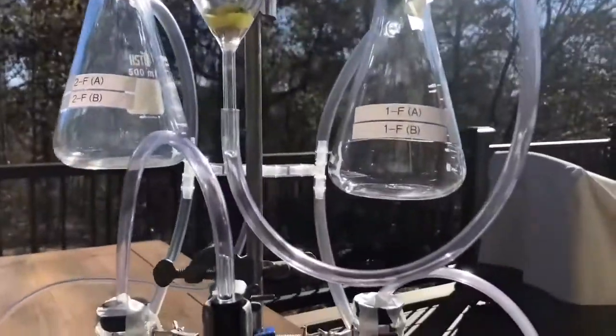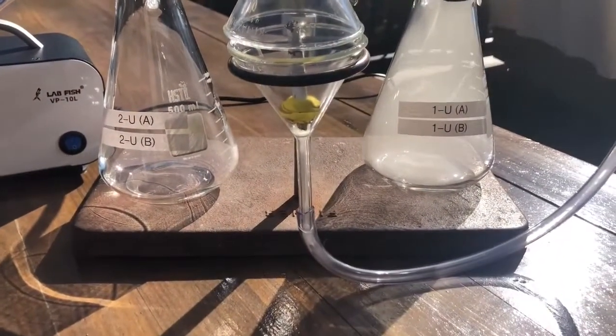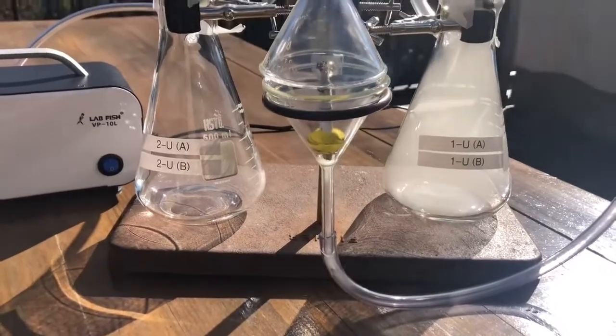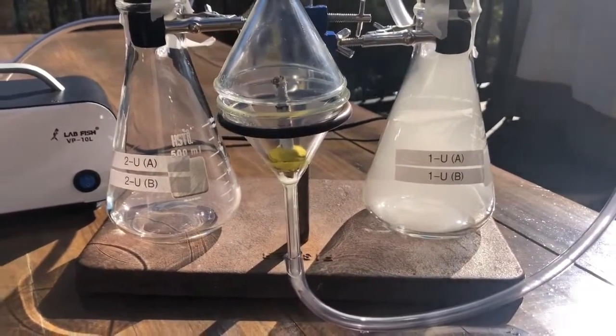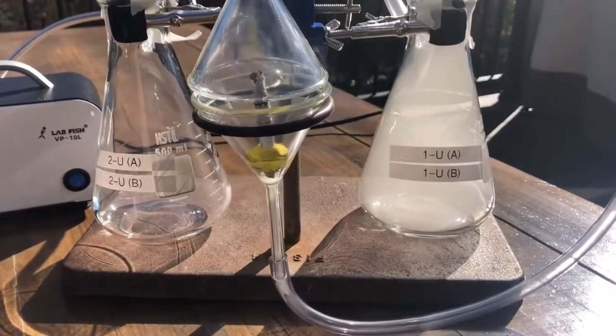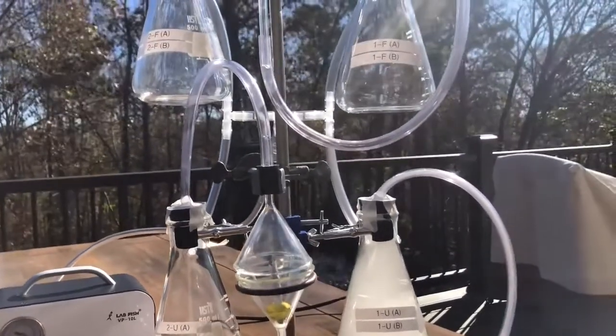While it's running, I just want to show you, there's the unfiltered. Even with our filter paper, there is the unfiltered cigarette there on your right. And that is the first-hand smoke versus the second-hand smoke. That's pretty impressive.